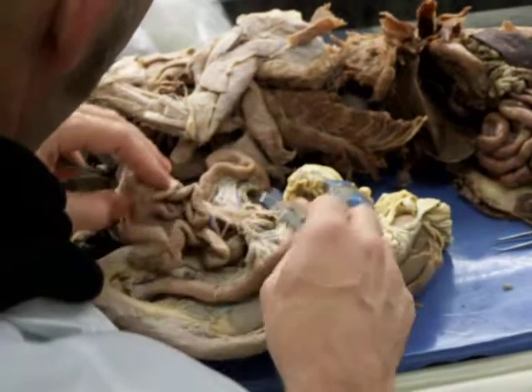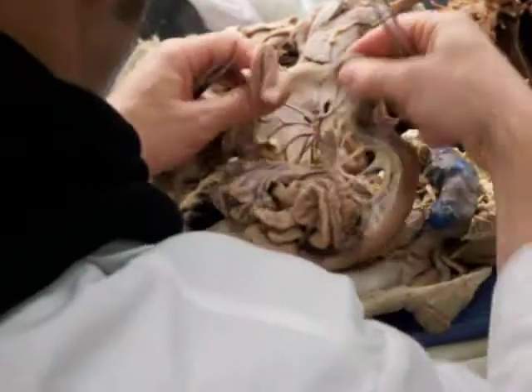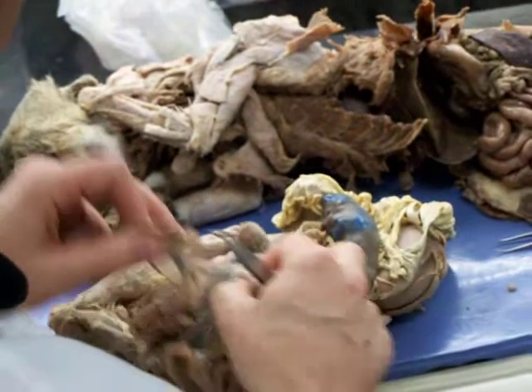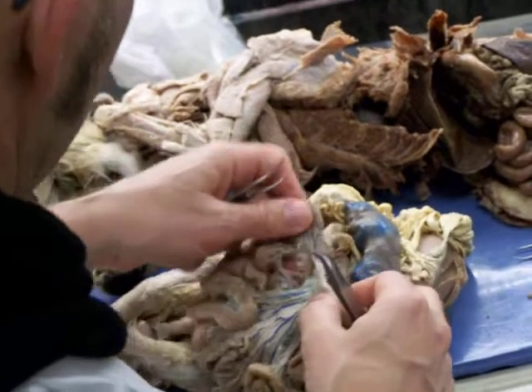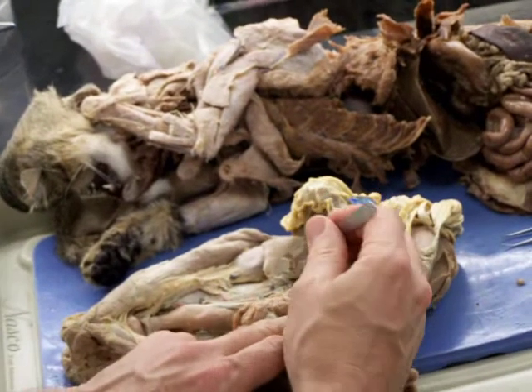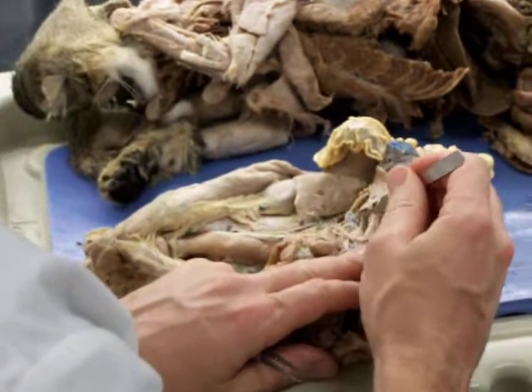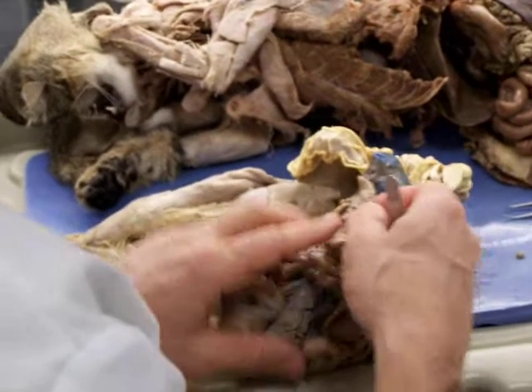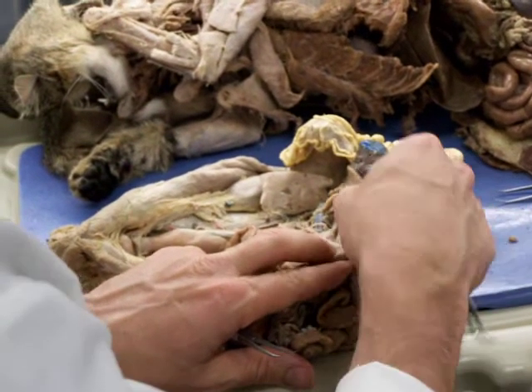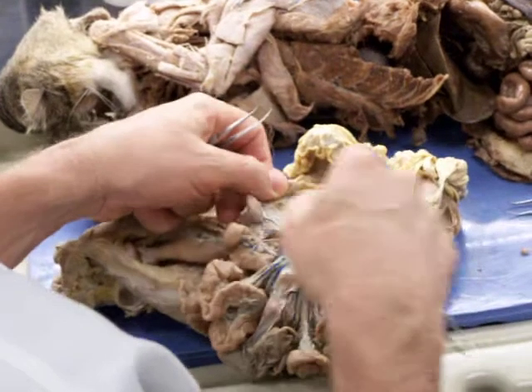And then there's another trunk of this. You look back over here. Just look at it on this side. Another trunk of this, see, this is looking at the cranial mesenteric from the other side. And there's another trunk that comes up here and runs up to the duodenum and then goes into that gap between the duodenum and the pancreas.